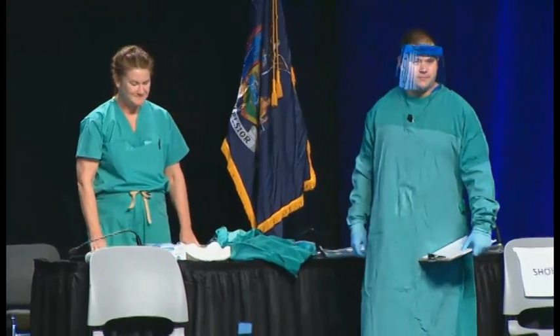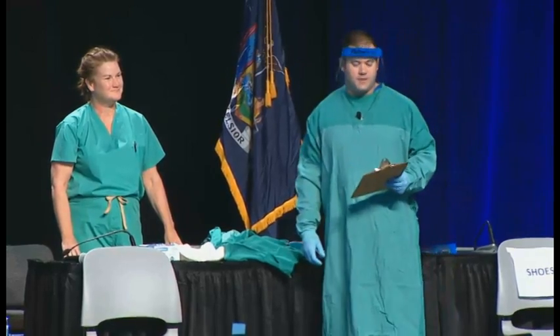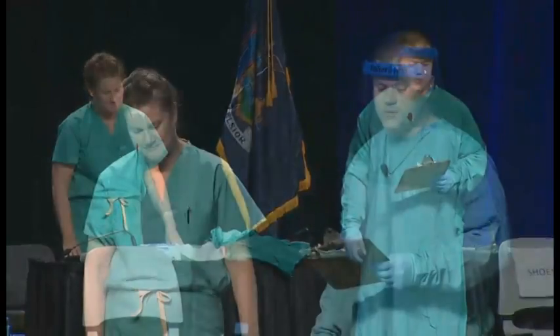Good morning, New York. I'm Brian Christensen. As Arjun mentioned, last night we released enhanced guidance for healthcare workers who may be caring for patients with Ebola. Barbara Smith, an infection preventionist from Mount Sinai, is going to help us with the demonstration. We are recommending that people have a trained observer, which I will be playing in this part, to ensure that they're following proper protocols and are less likely to have an exposure.